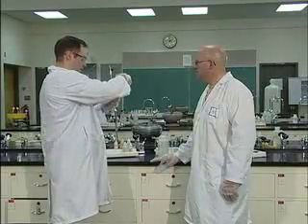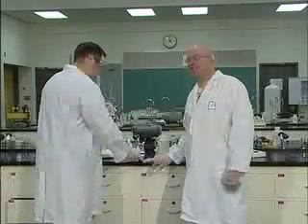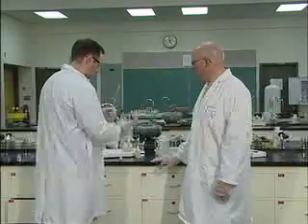So we're going to add this calcium oxide and we should see something happen. Before we do that, we have to do our litmus test.